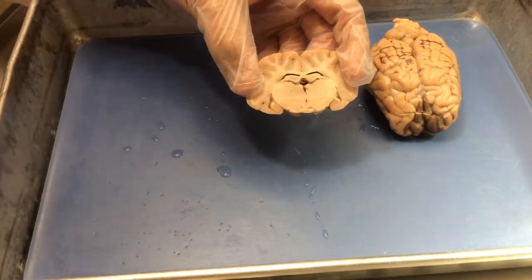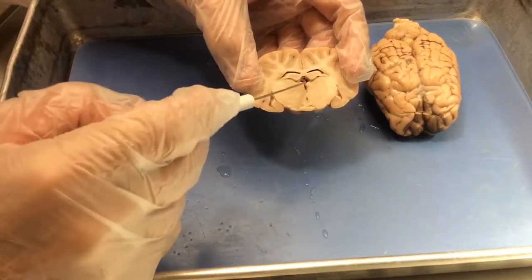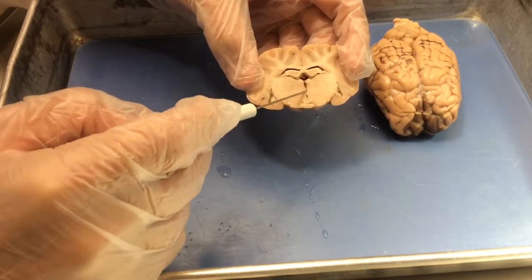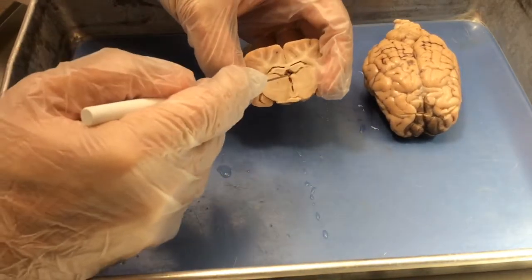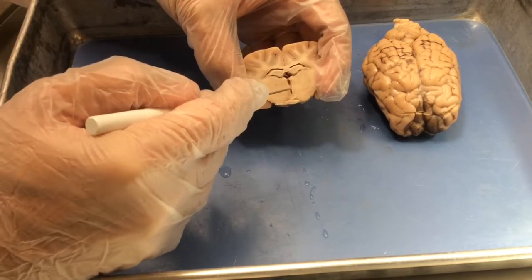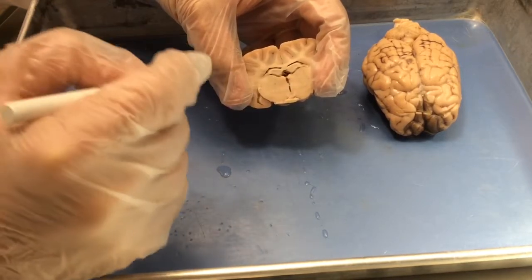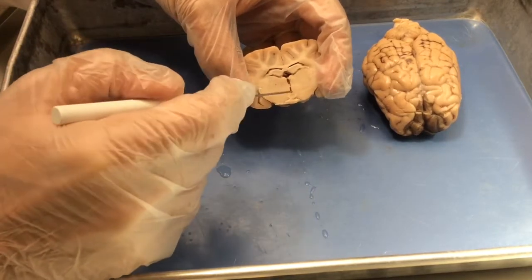Hippocampus is a pretty dramatic structure in the sheep brain, and in the human brain for that matter. Ventral to the hippocampus is the third ventricle. The third ventricle runs along the midline. It's usually largest right underneath the hippocampus and forms a line. Sometimes you'll see disconnected regions of ventricle along the midline. That's all third ventricle, and this choroid plexus is in the third ventricle.